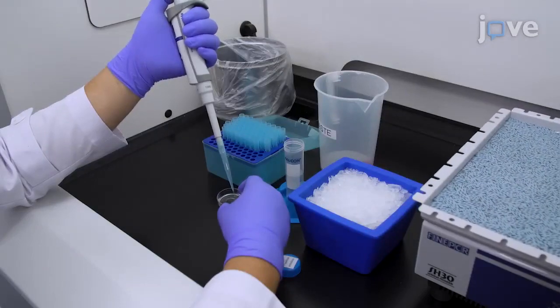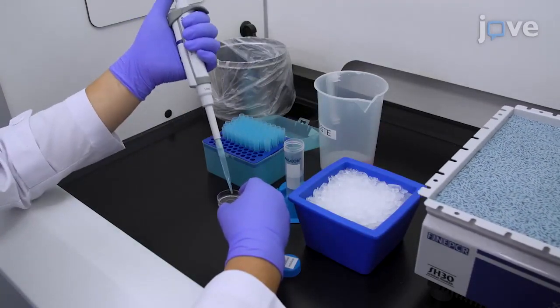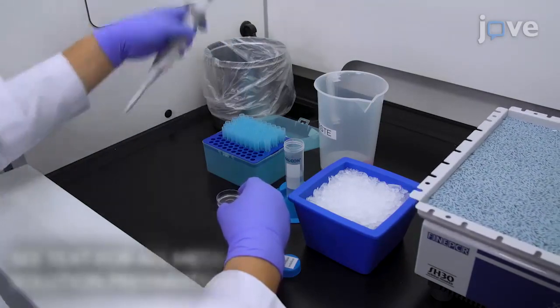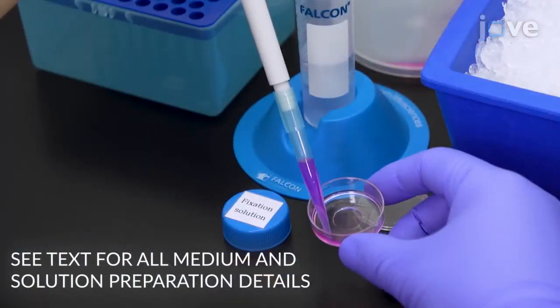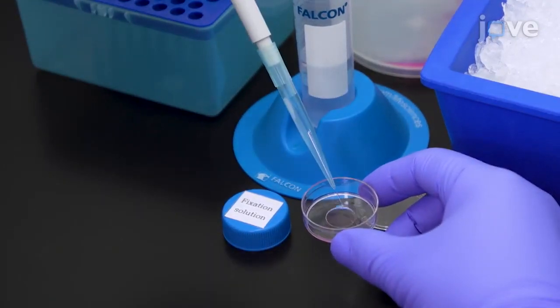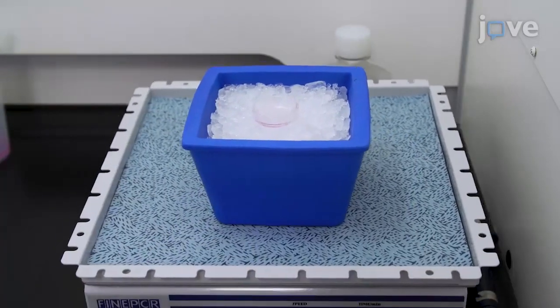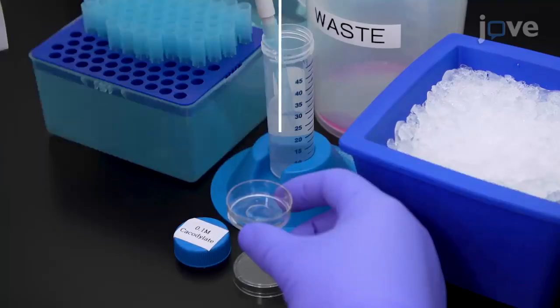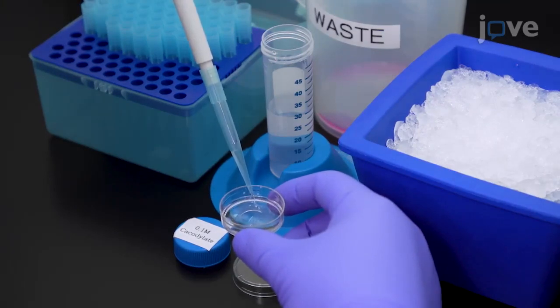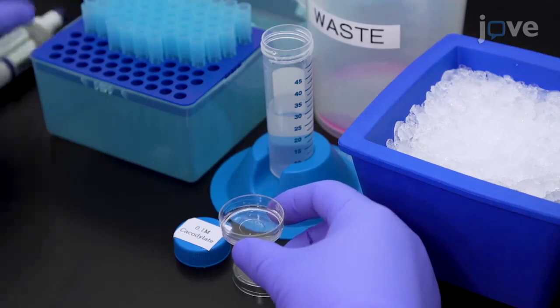16 to 24 hours after transfection, gently wash the culture with 250 microliters of 30 to 37 degrees Celsius fixation solution, quickly replacing the wash with 1.5 milliliters of fresh fixation solution and placing the culture on ice for 30 minutes. At the end of the incubation, rinse the cells with 3 10-minute washes using 1 milliliter of ice-cold 0.1 molar sodium cacodylate buffer per wash.